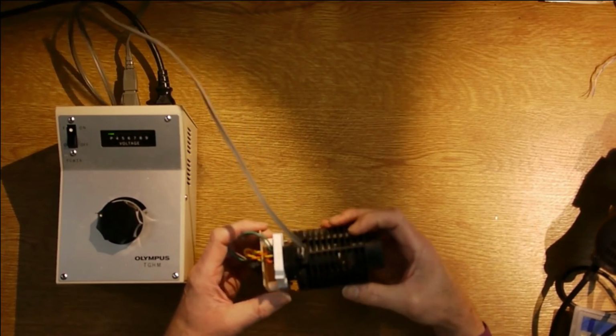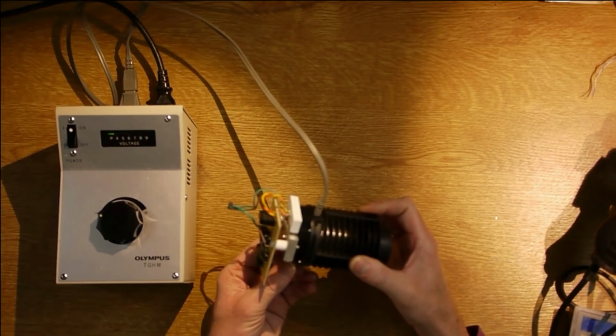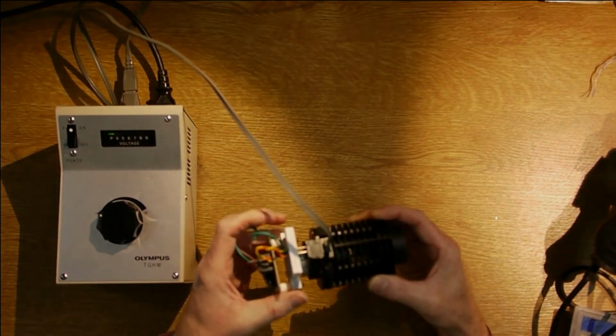So that's what I use now for the illumination of my microscope. It's working quite well, apart from the strobing problem I've got, so I'm going to be investigating that pretty soon.